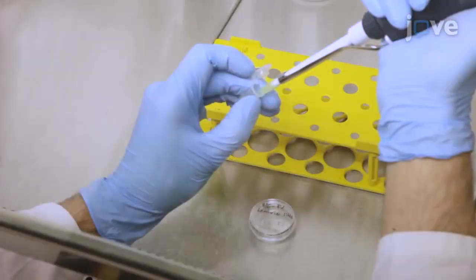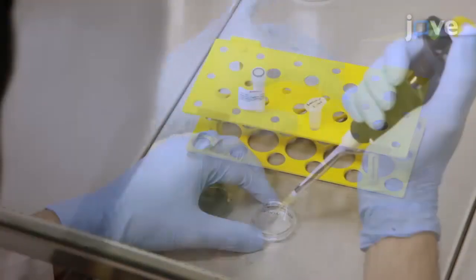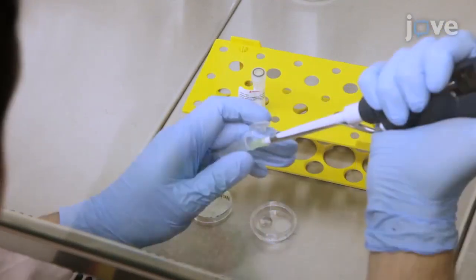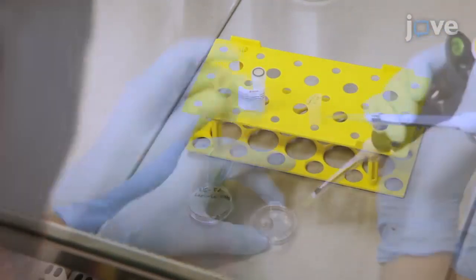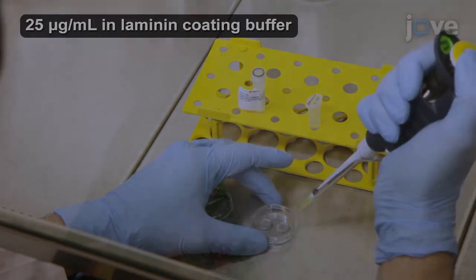For the B16F1 cells, coat 15 mm coverslips with 150 µL of laminin solution and incubate for one hour.